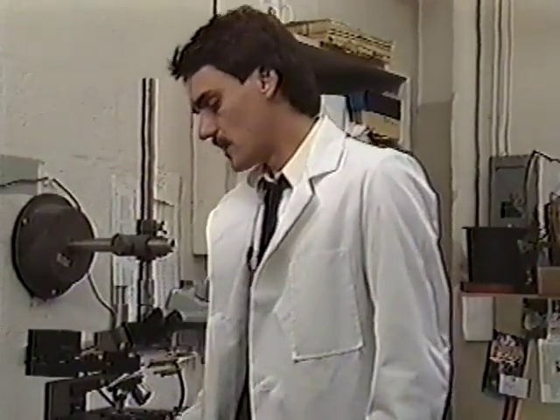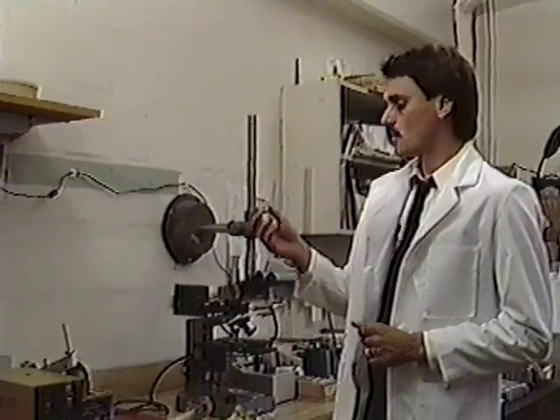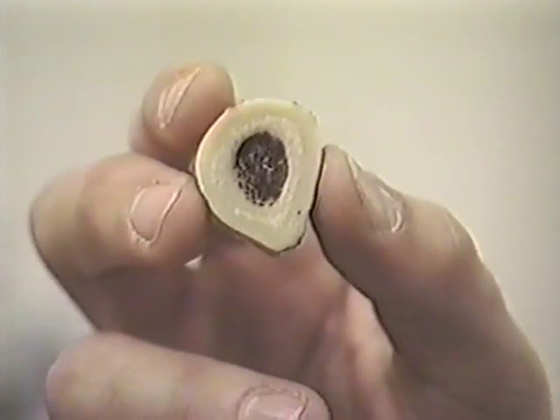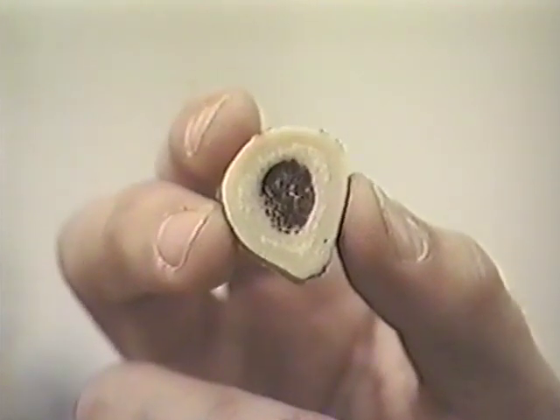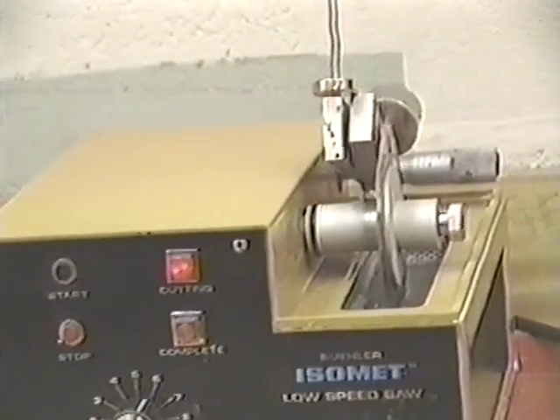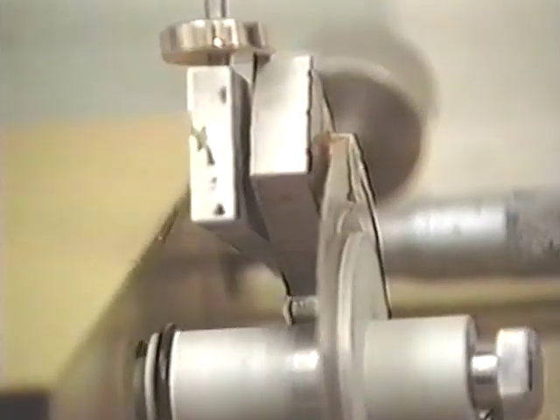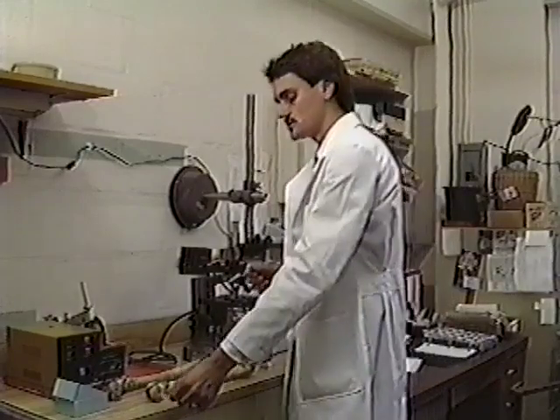A second major problem I feel with this technique is, of course, the time and the effort and the equipment it takes to start with a specimen like this and end up with something you can view under the microscope. There obviously is equipment involved and a lot of manual time. I take a specimen that has been cut off, and I need to grind the specimen down to about 80 microns and then polish it very carefully so no scratches show up under the polarized light.